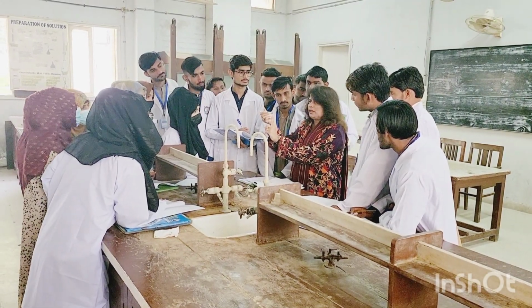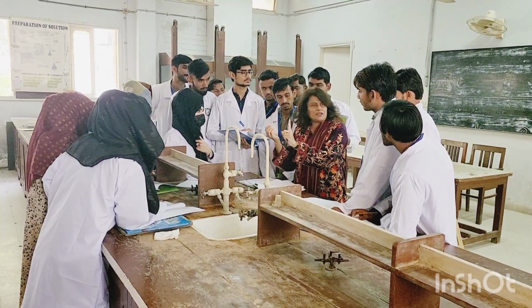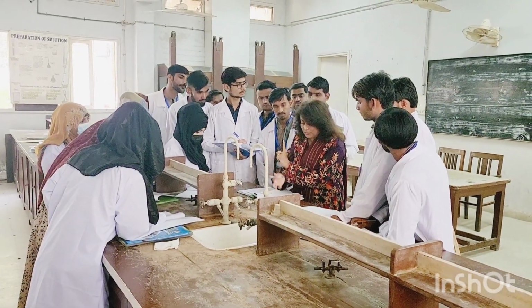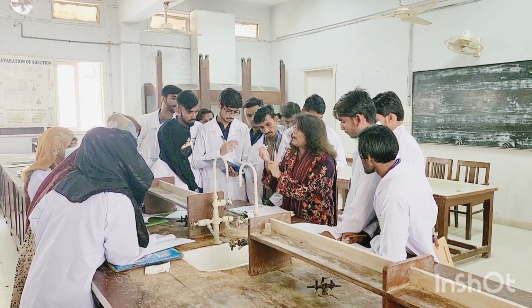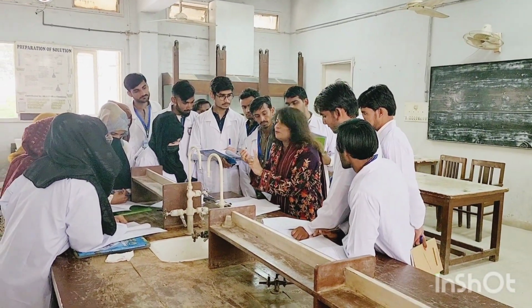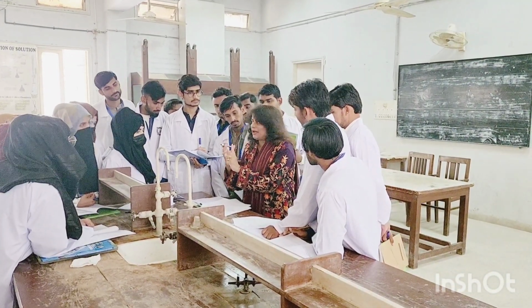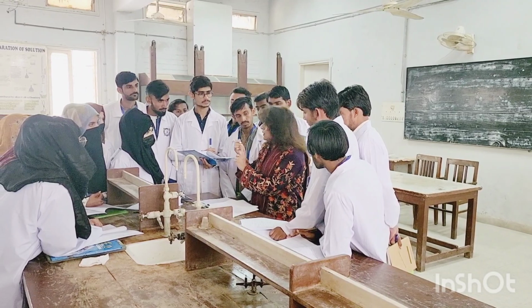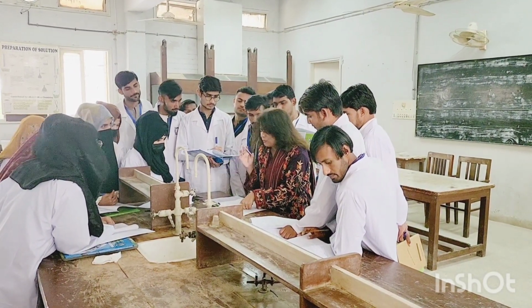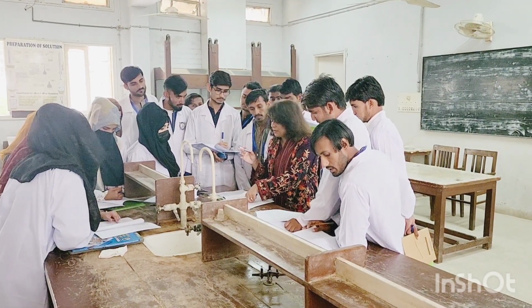And now you are going to see what type of fumes are emerging from that. Whether they are whitish, whether they are a little bit grayish, or if they have some other color. So if it's blackish or something, it's burning with the soot. We call it soot. That means a lot of carbons are there. So that's why it has got a soot. We call that smoky flame soot. Burned with a sooty flame, so it could be aromatic or a highly unsaturated aliphatic compound.